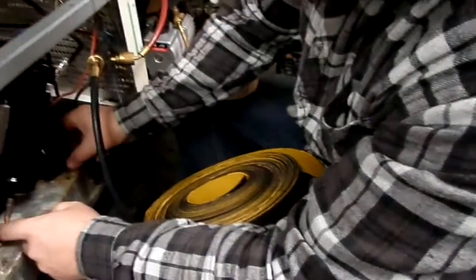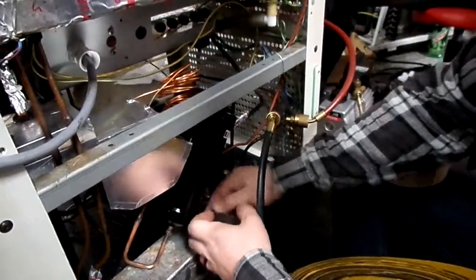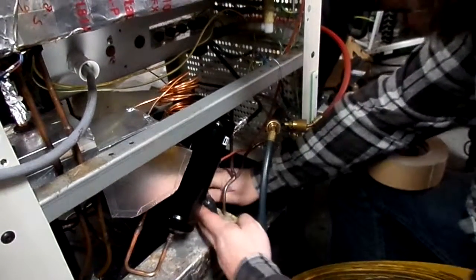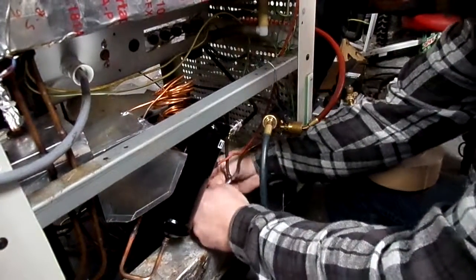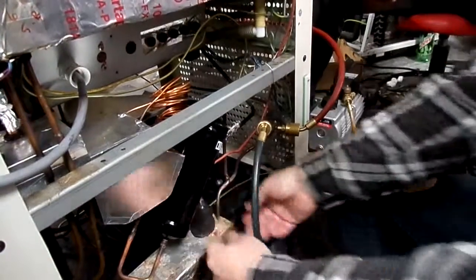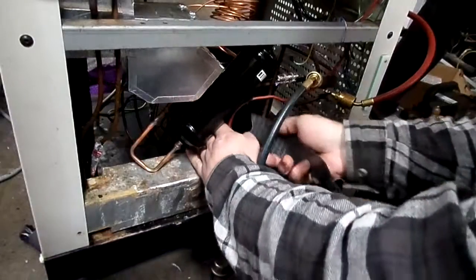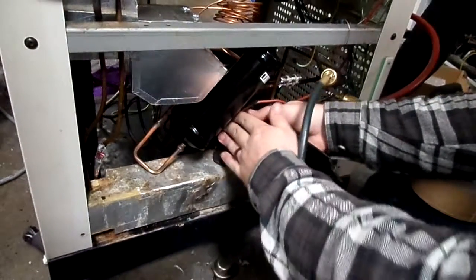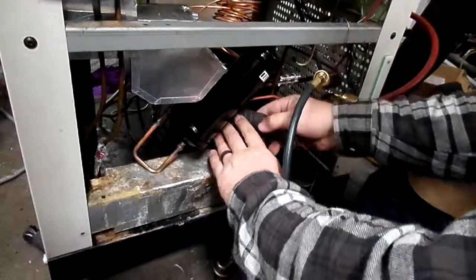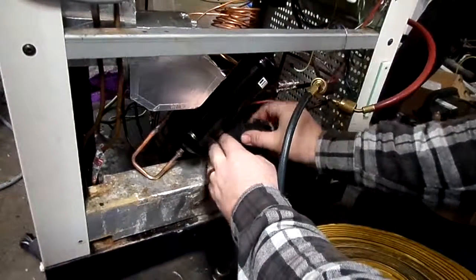Any part on the high side of things, the hot side, you're gonna leave exposed because you want that to cool in the ambient temperature. The cool stuff, you don't want to absorb the heat from the ambient temperature. So give it a good few wraps around like that, and then that'll be it for the installation. We'll come back once it's all wrapped up for the charging of the Freon and starting it up.